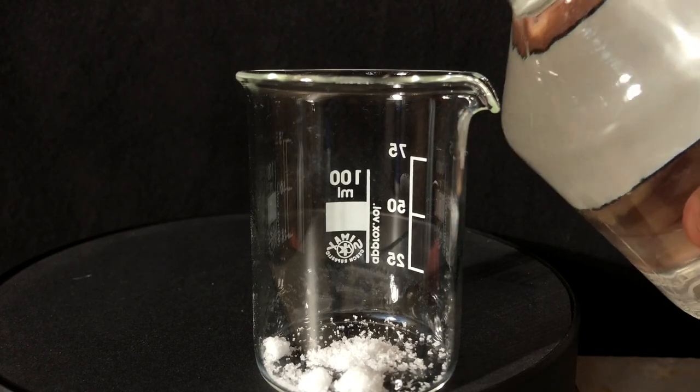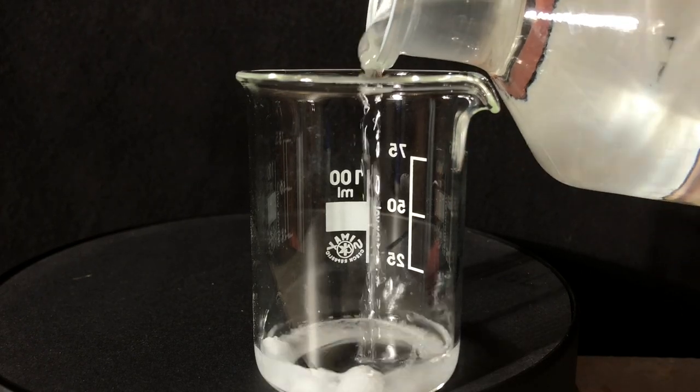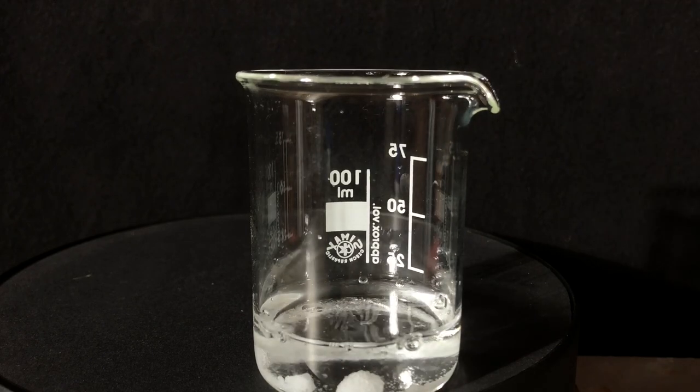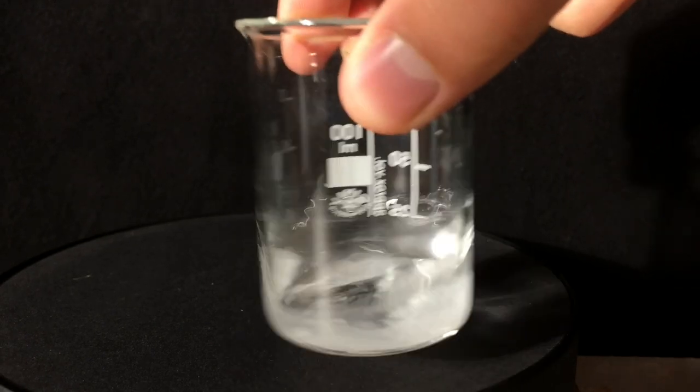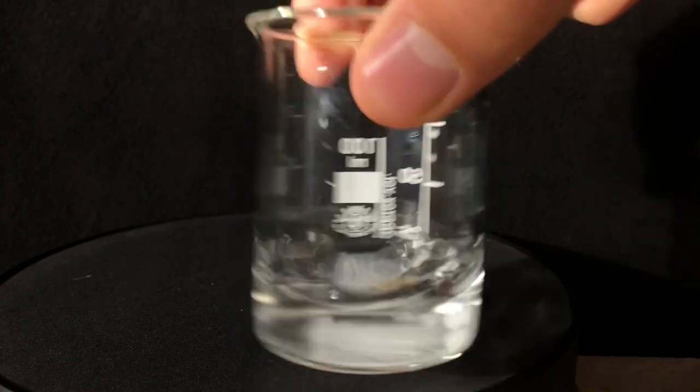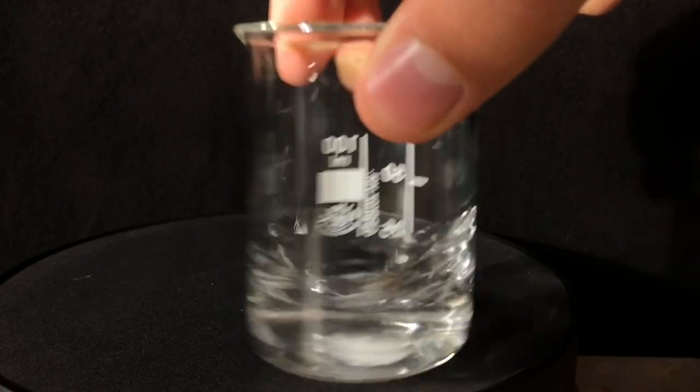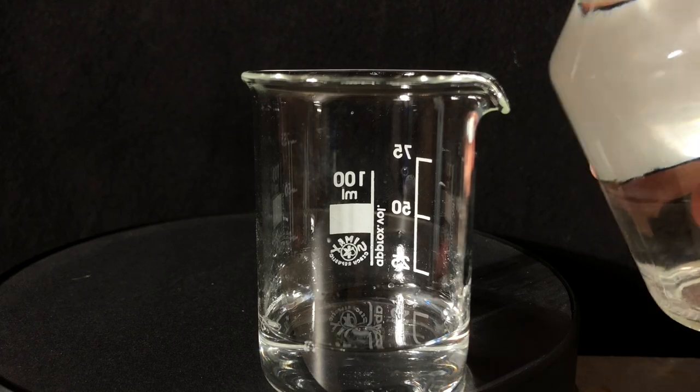A small amount of distilled water was added to the beaker to dissolve the nitrate. The reason I am not filling the beaker in the beginning is that a small amount will be easier to swirl around without spilling the nitrate solution onto my skin. The moment the silver nitrate had dissolved, more distilled water was added.